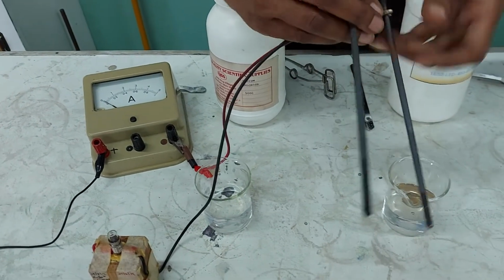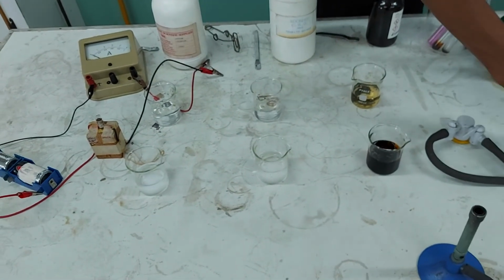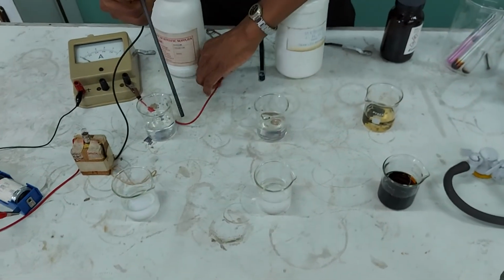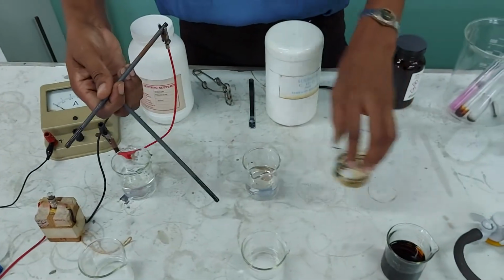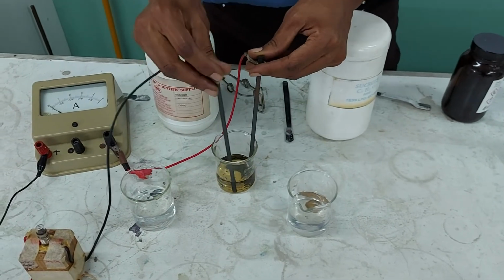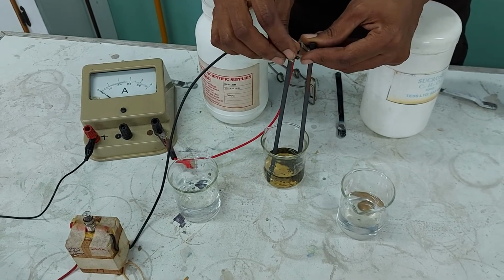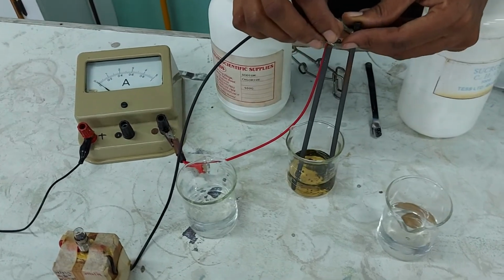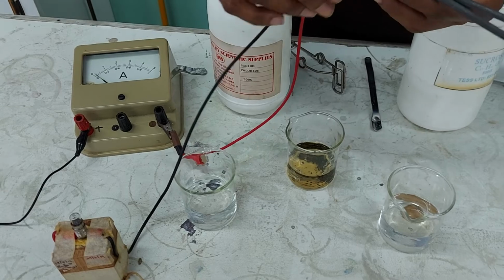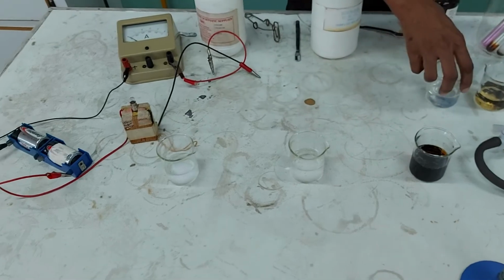All right. The last one, I'm going to give my electrodes a brief rinse again. And we're going to take a look at my iodine. All right, I am waiting for the drama to unfold here. Somebody tell me if you're seeing any drama unfolding. Looks pretty flat to me. Okay, so that is the conduction of the sodium chloride, the iodine, and the sucrose in water.